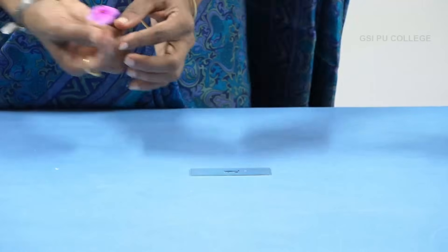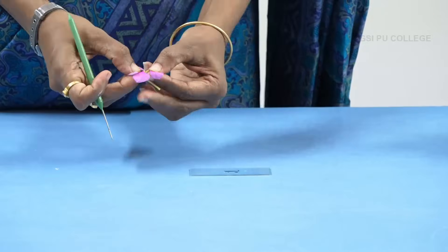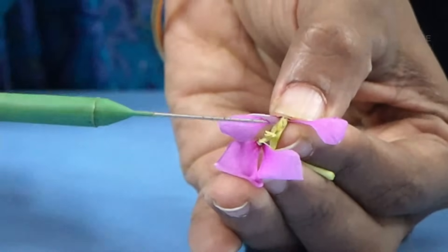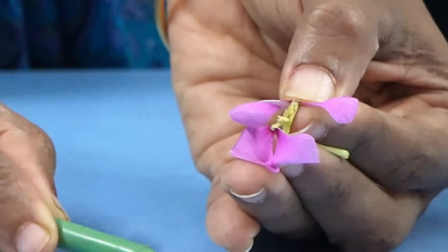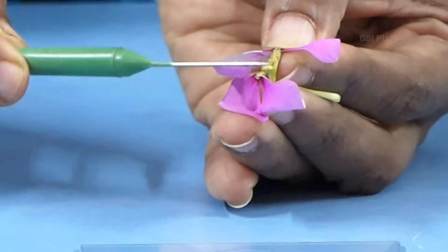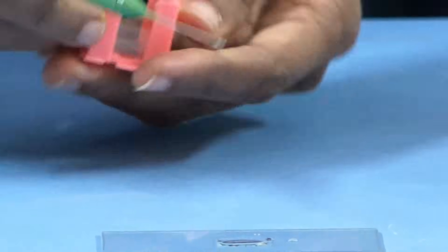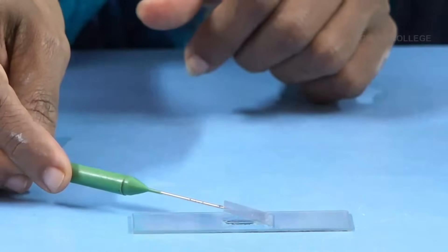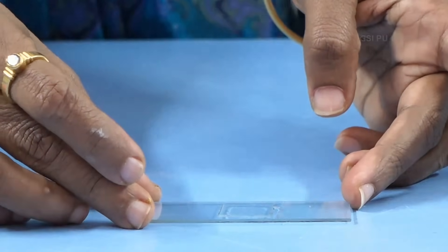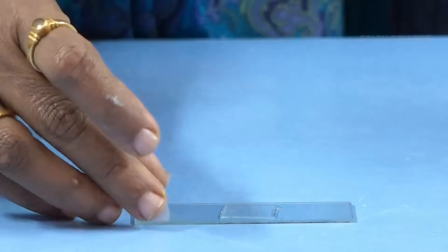This is a Vinca rosea flower. You have to open it like this. These yellow structures are nothing but anthers. You have to dust the pollen grains here. Take a needle, dip it to make it wet, then touch it towards the yellow part and dust the pollen grains onto the sucrose solution on the slide. Then cover this with a cover glass and keep it aside for 20 to 30 minutes. After 30 minutes, you have to focus it and show it to the examiner.